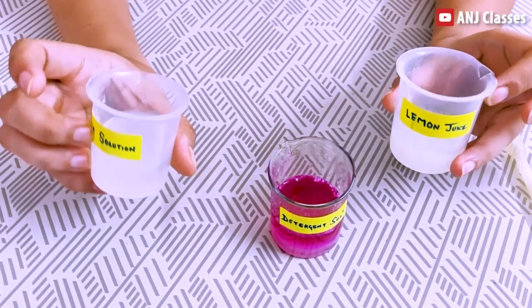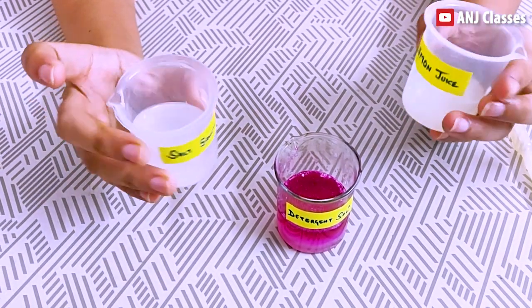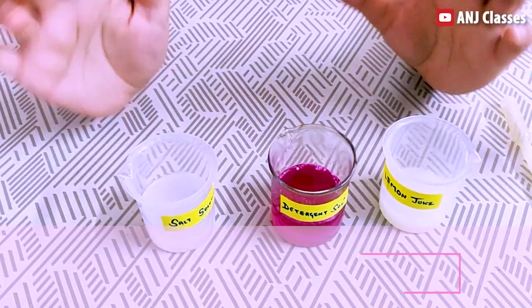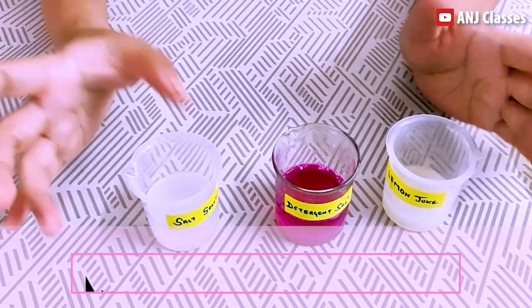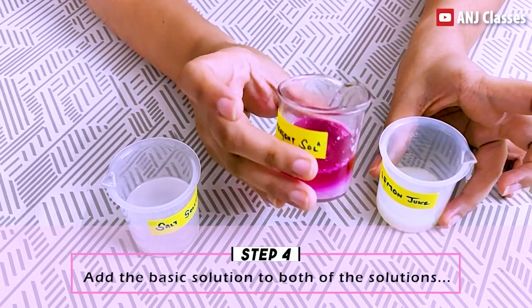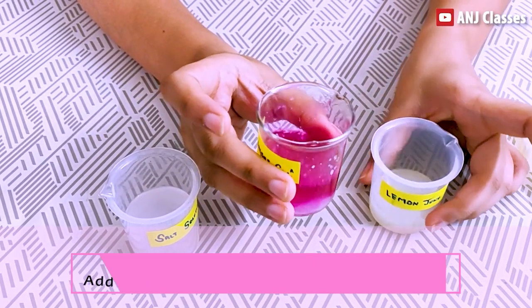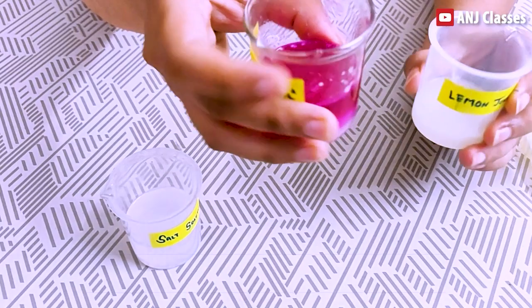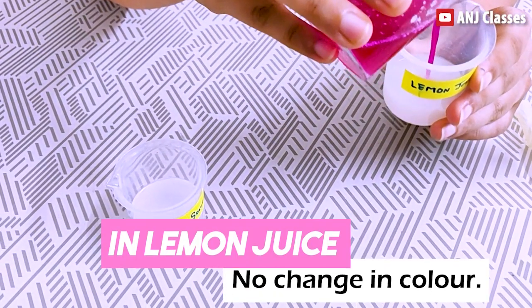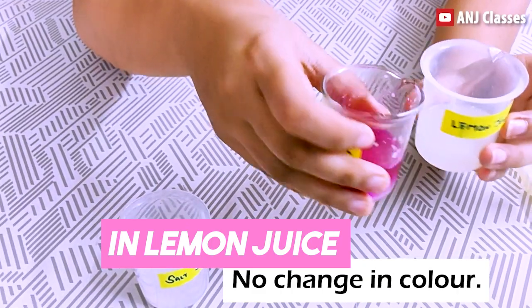But now, how will we distinguish whether our solution is acidic or neutral? Because in both cases there is no change in color. For this, first we will add our basic solution, that is detergent solution, into lemon juice, which is my acidic solution.